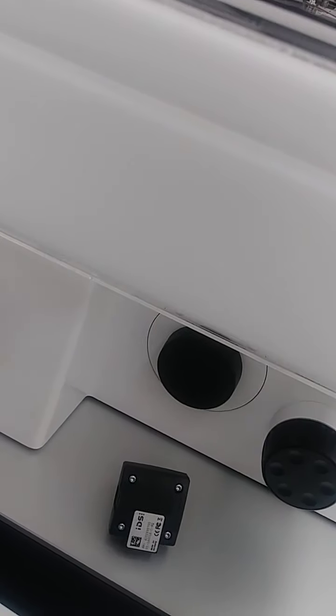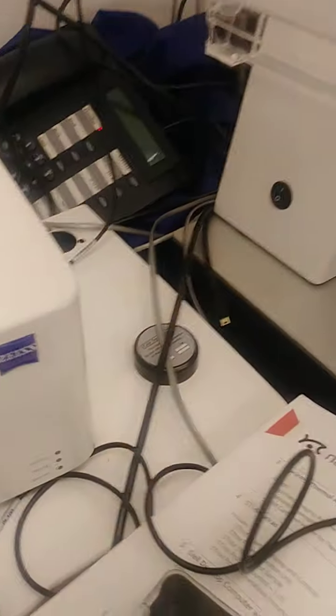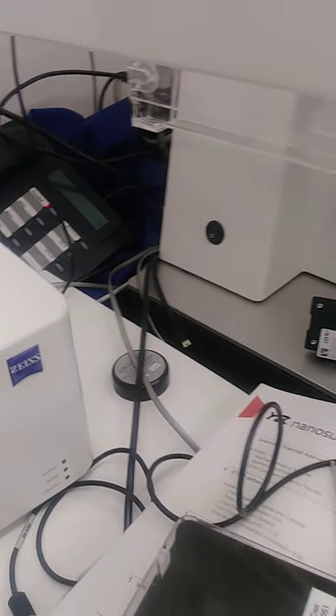So the switch points, right? If you're going to be doing fluorescence, it goes down. If you're going to be doing the transmitted light, it goes up. So I'm going to set it down now for fluorescence.